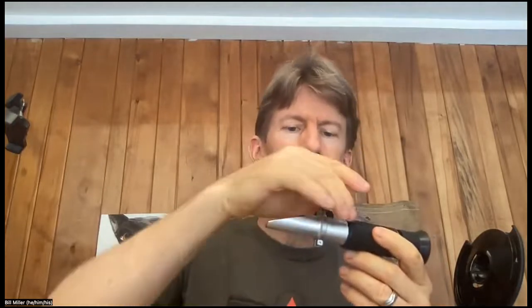I've got my refractometer here, I've got a pipette, and I've got my coffee. What I'm going to do is I'm going to take my coffee and drip two or three drops on the top of the prism.